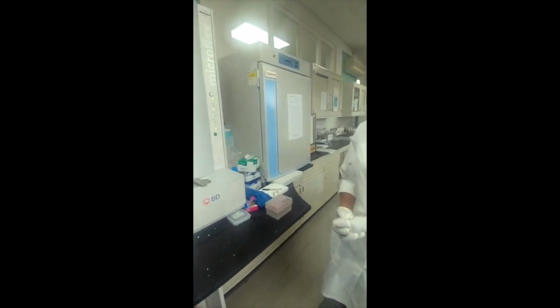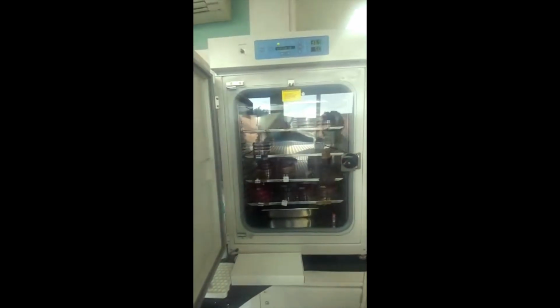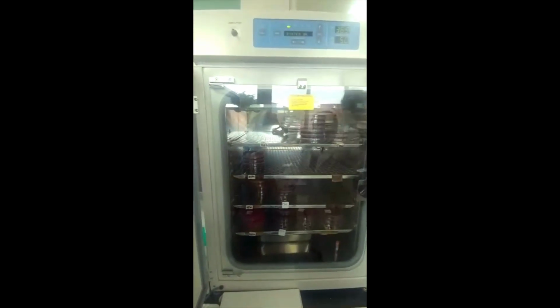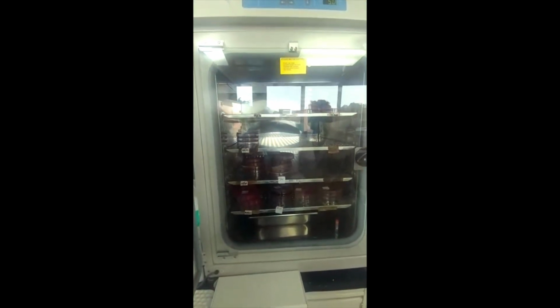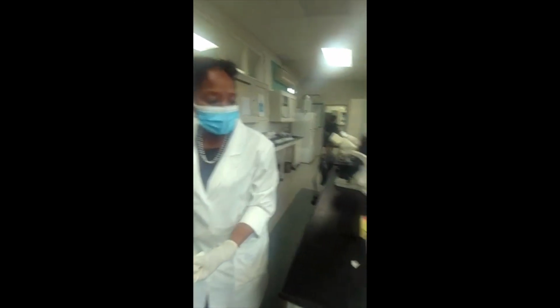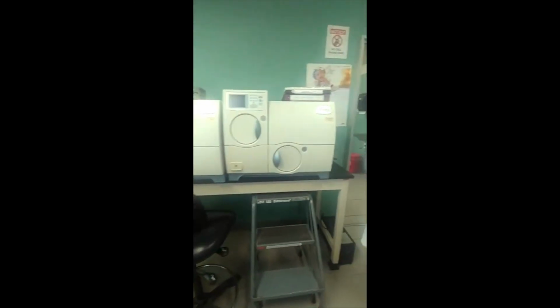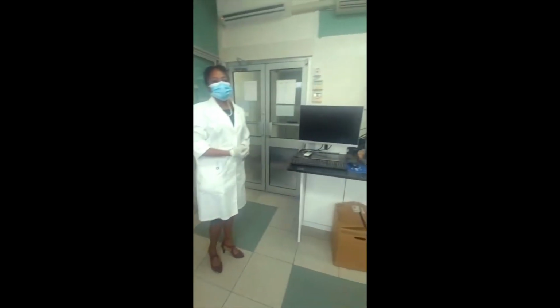So Miss, you showed us a walk-in incubator. What's this? Okay, so this is also another type of incubator. This one is our CO2 incubator. What this does is it gives you the right amount of CO2, 5%, that is needed for organisms that need CO2 to grow. We call them capnophiles. There are some incubators that can generate anaerobic conditions. Otherwise, for the obligate anaerobes, we use jars that will have gas packs in them. I'm looking to see if we have any. We may have to go in the other incubator. We put the plates in those, and then the anaerobic conditions are established there, and the organism will grow.